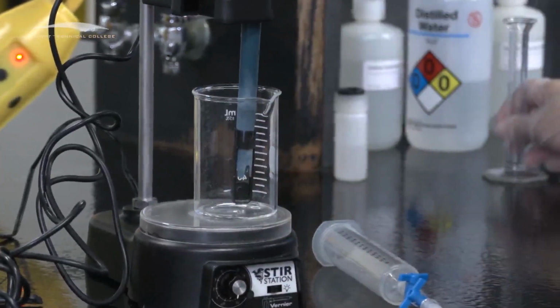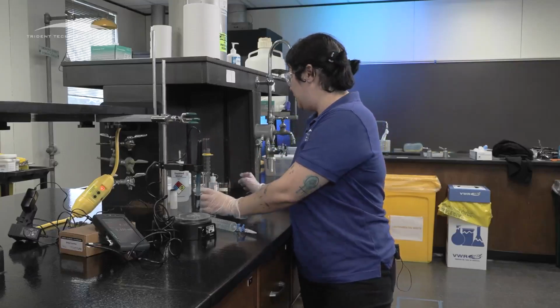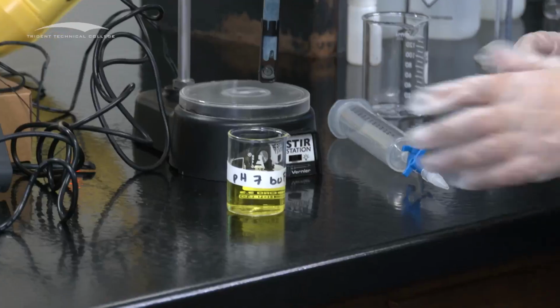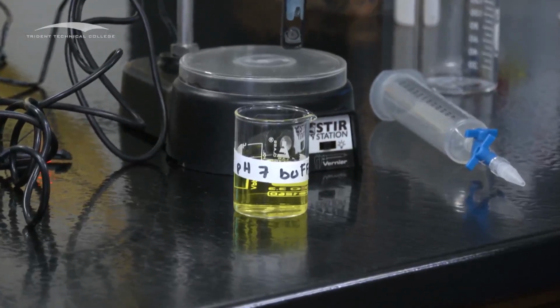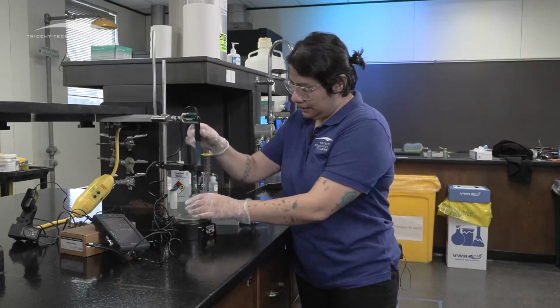And actually, let's calibrate the pH probe first. You're gonna need a pH 7 buffer. There are multiple buffers. We're gonna use the pH 7 because we're gonna do a 1-point calibration. There are multiple calibrations that you can do, but the 1-point calibration is the easiest one. So we're gonna stick that in there.